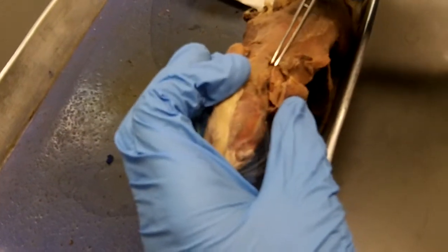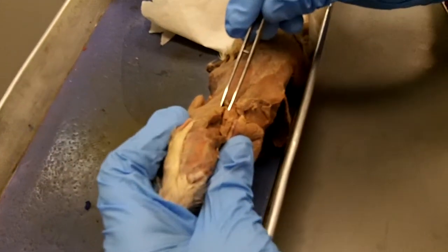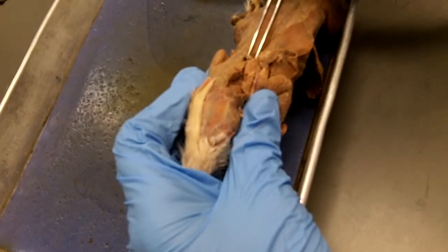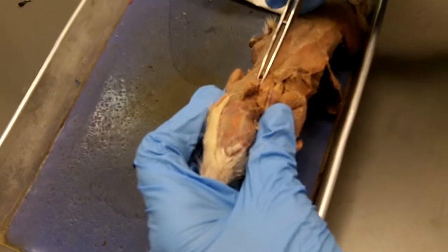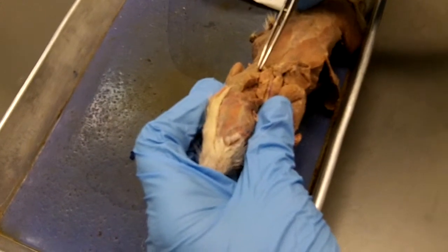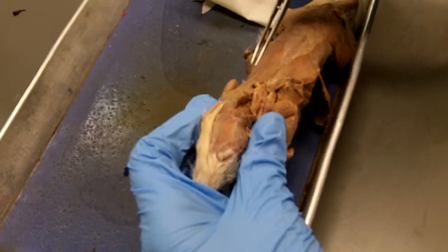There was a muscle that was very thick, small, short, that we could see that ran between the scapula and the vertebral column, right in this area. The fibers ran back and forth like that, and that's called rhomboideus. Rhomboideus has two divisions that you're not expected to tell the difference between. Just rhomboideus. But rhomboideus capitis is a completely separate muscle, and you need to know that as a separate muscle.